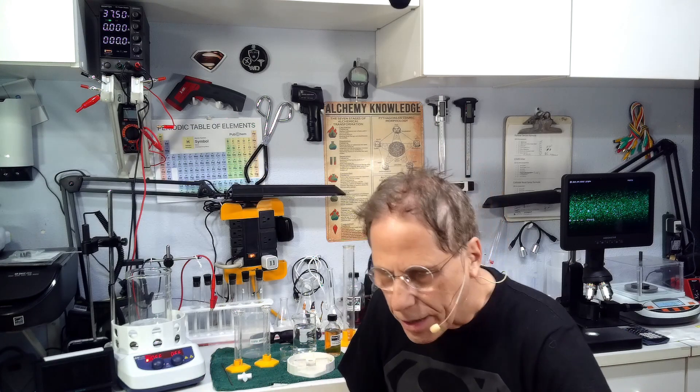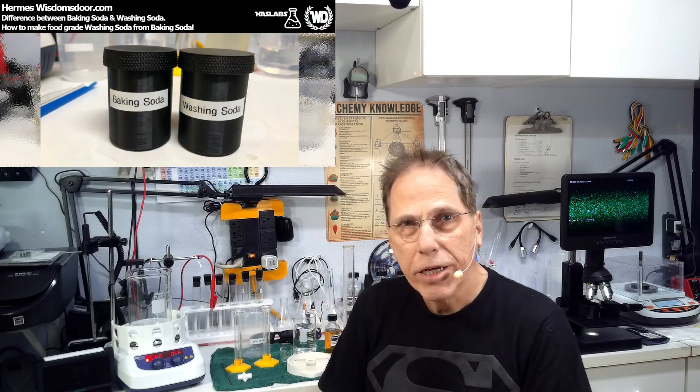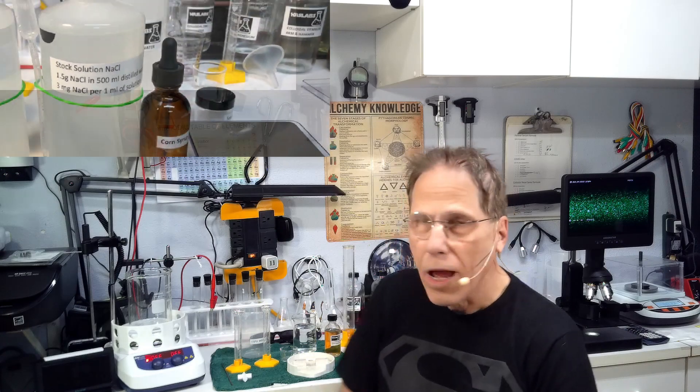Welcome to Reality Creative Video, I'm Hermes, and it's time for part two of platinum. Prerequisites to this video are making colloidal platinum start to finish part one, how to make washing soda, how to make stock solutions, the power supply video.